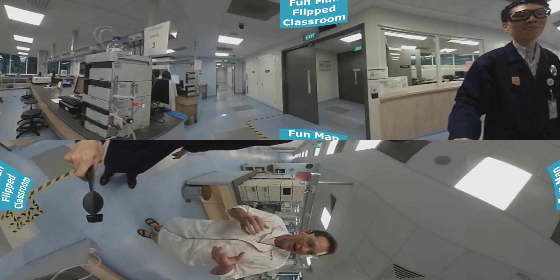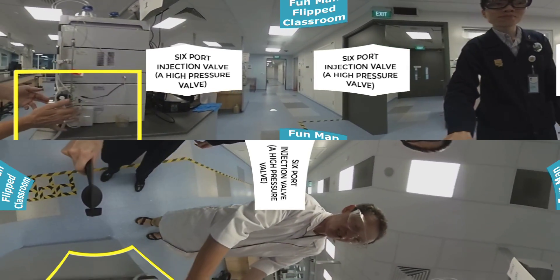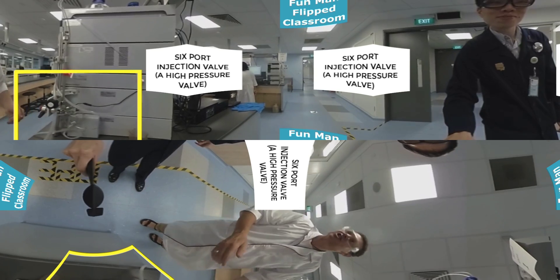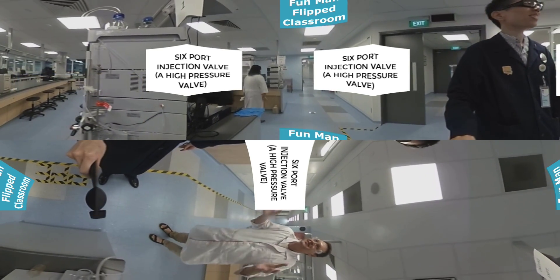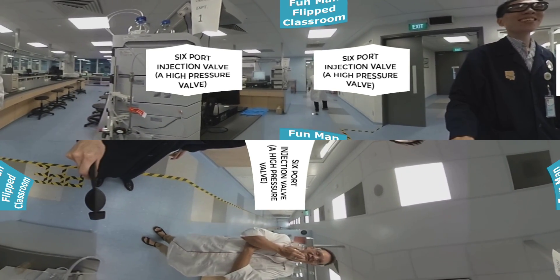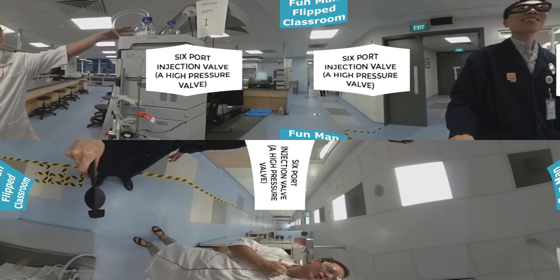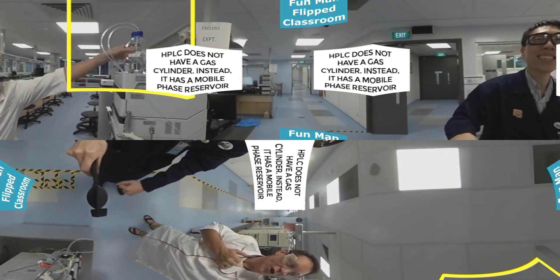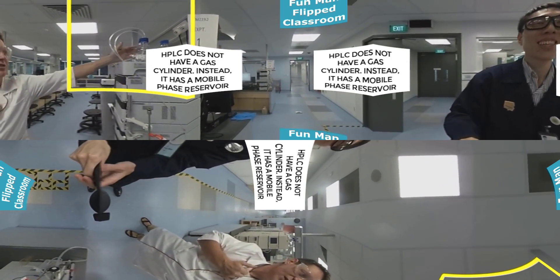There are other giveaways as well. You've got a six-port injection valve here, which is a high pressure injection valve. So there's a number of clues that it's liquid chromatography. You've got no gas cylinders, but you've got a solvent reservoir here.